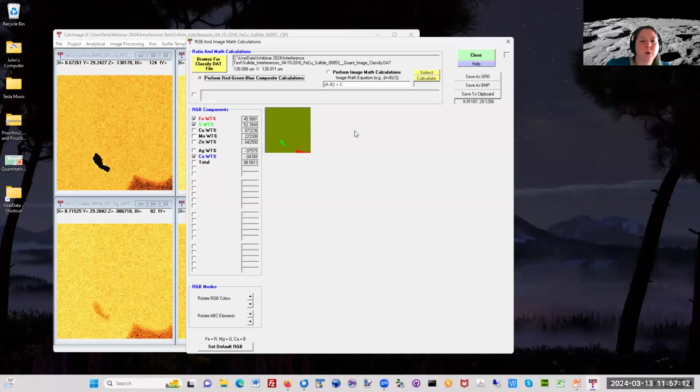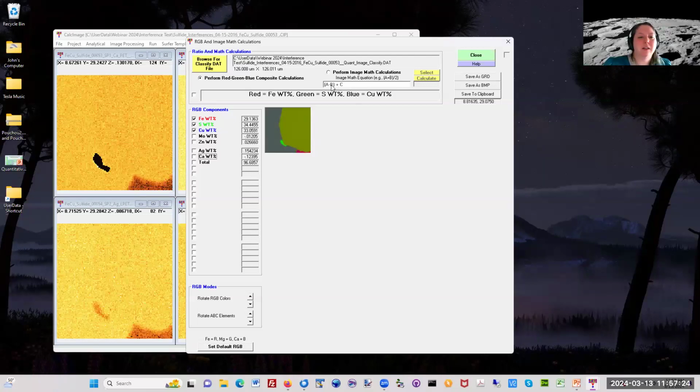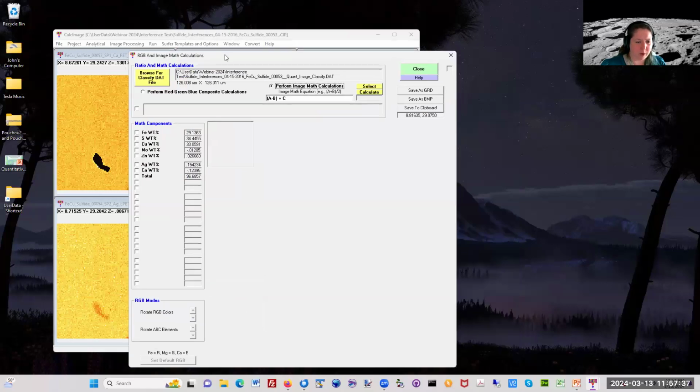When you define the image math calculation, you can select whatever map. Oh, that's not right. Sorry, I was grasping at what you're supposed to do. Thank you. It asks you which element is each parameter. You select that and then click on whatever map you want to define as A, B, and C. You can do that quite easily.